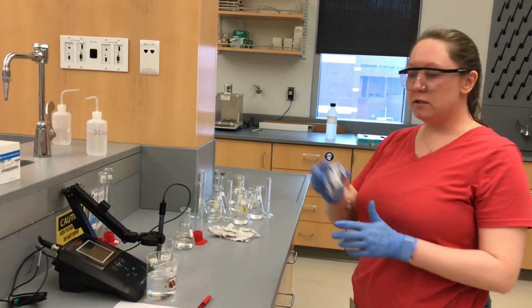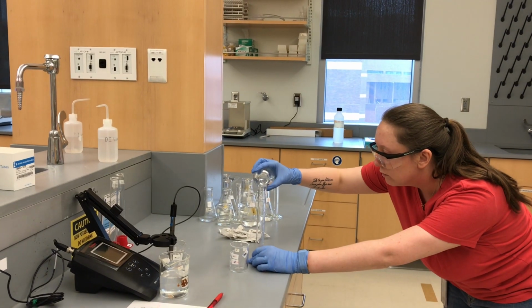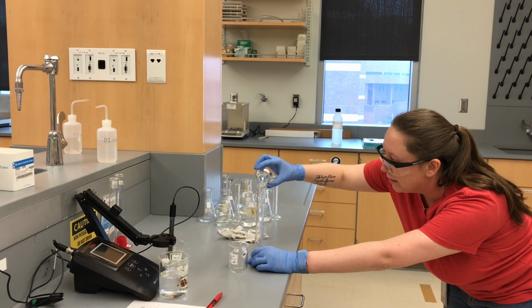All right, our last one, G plus NaOH. Let's get this bread, as the youngins say.